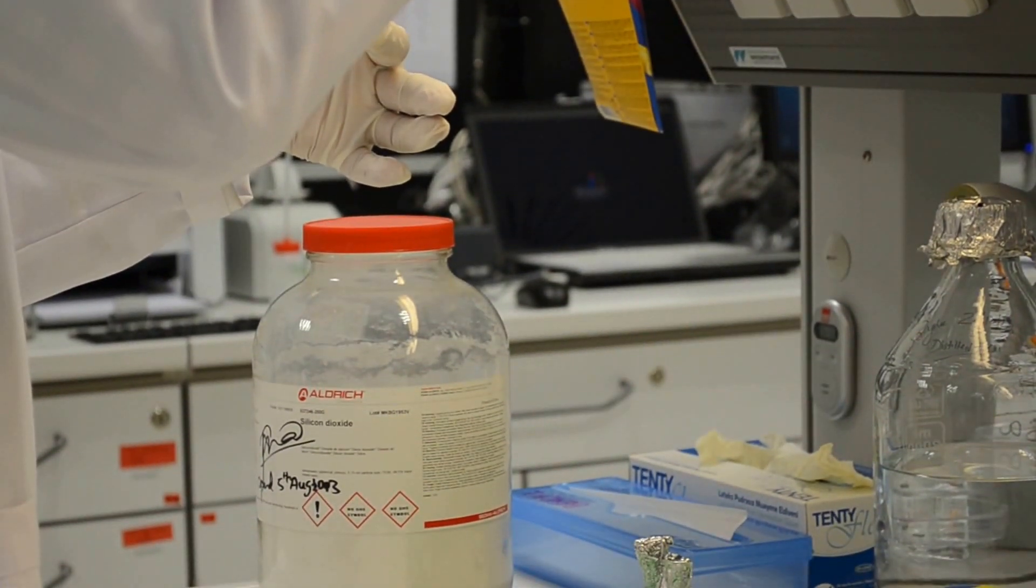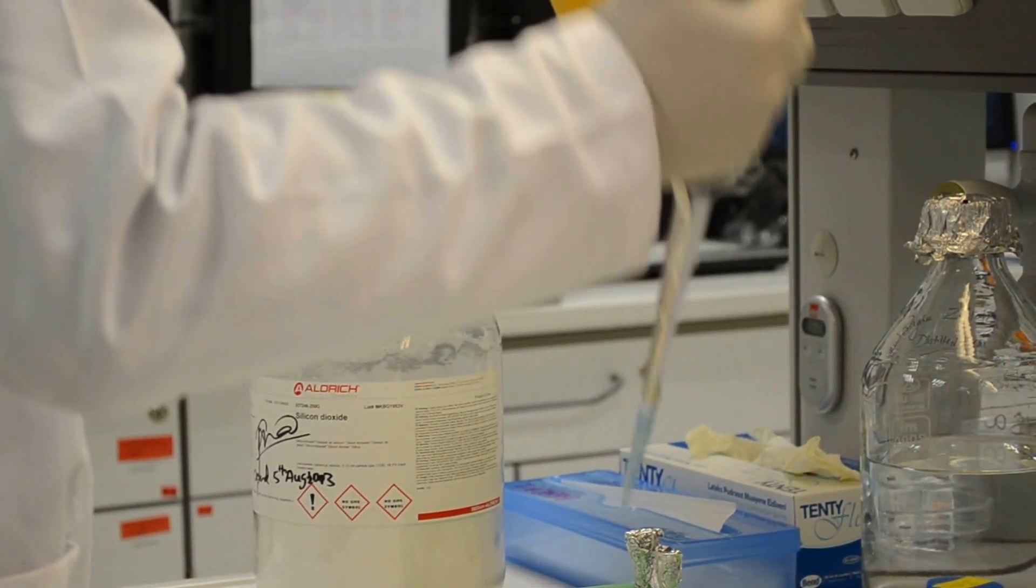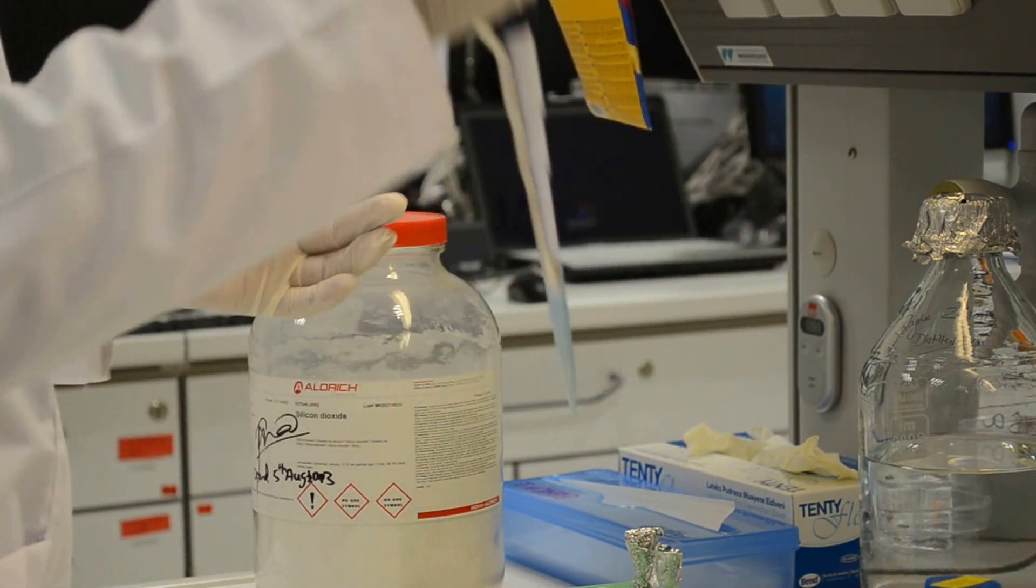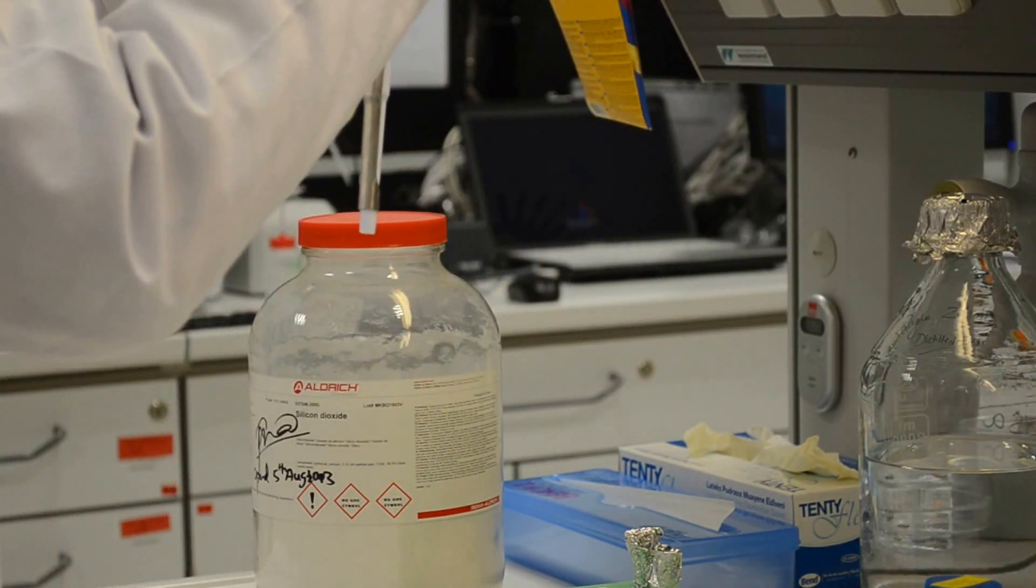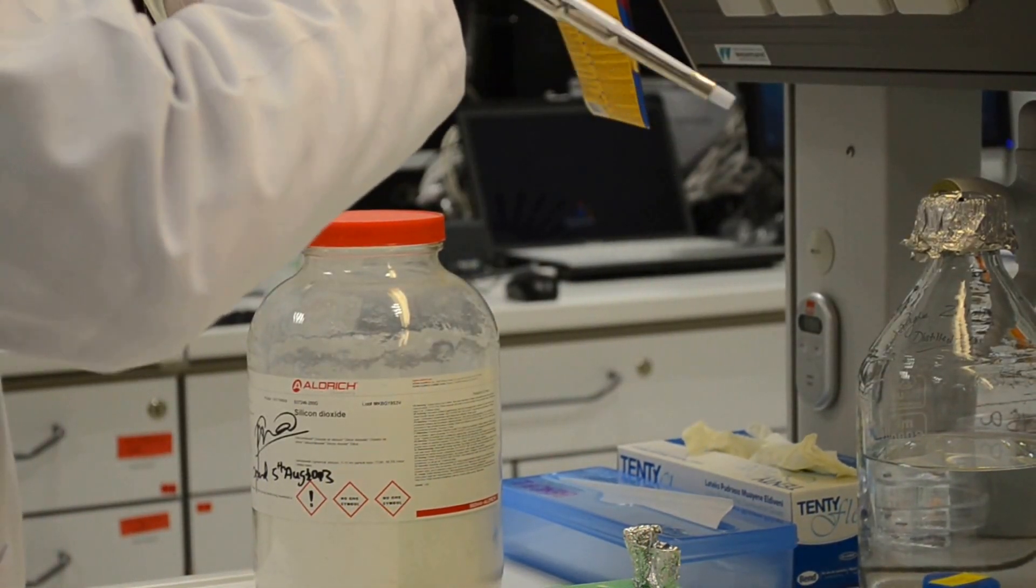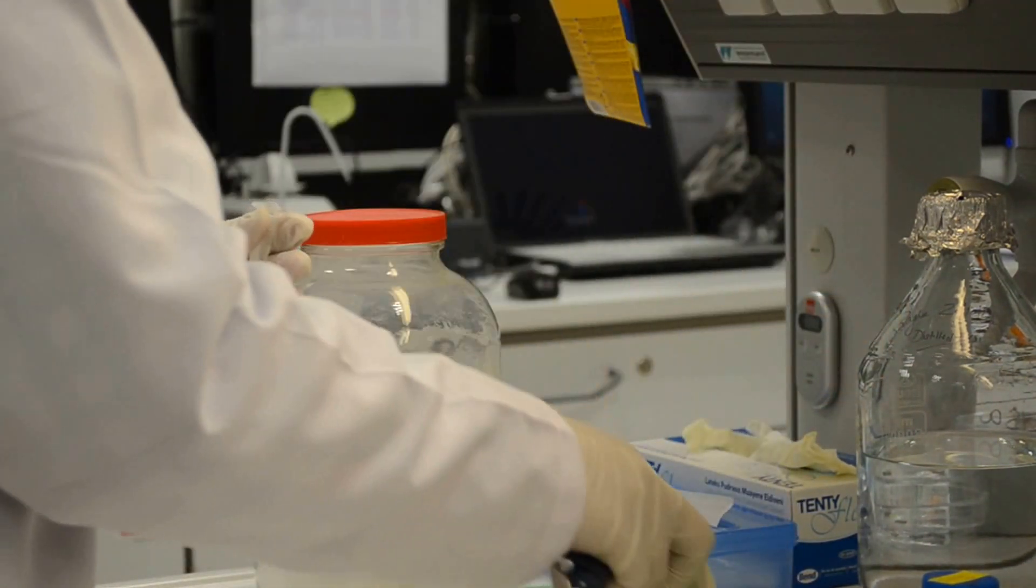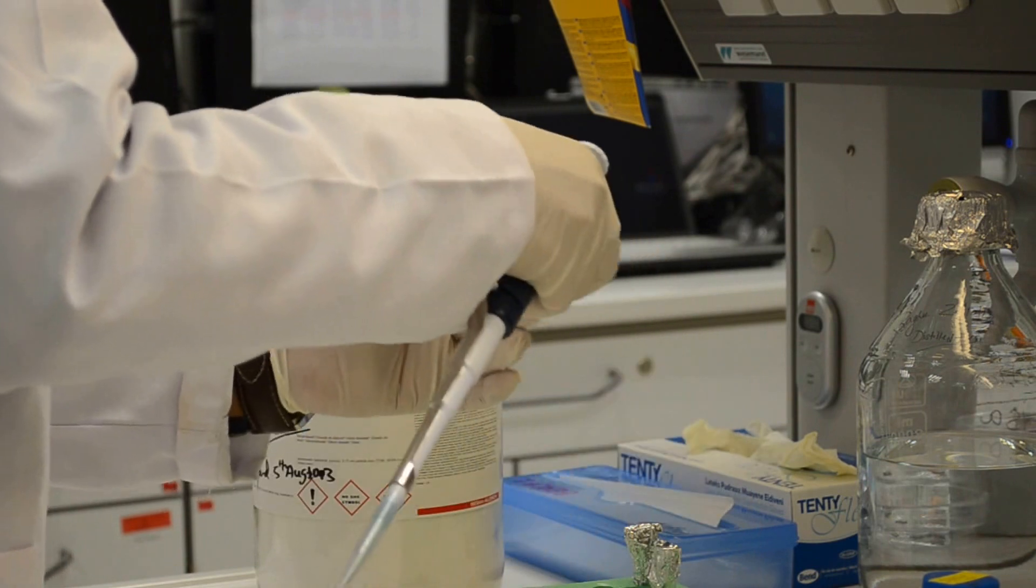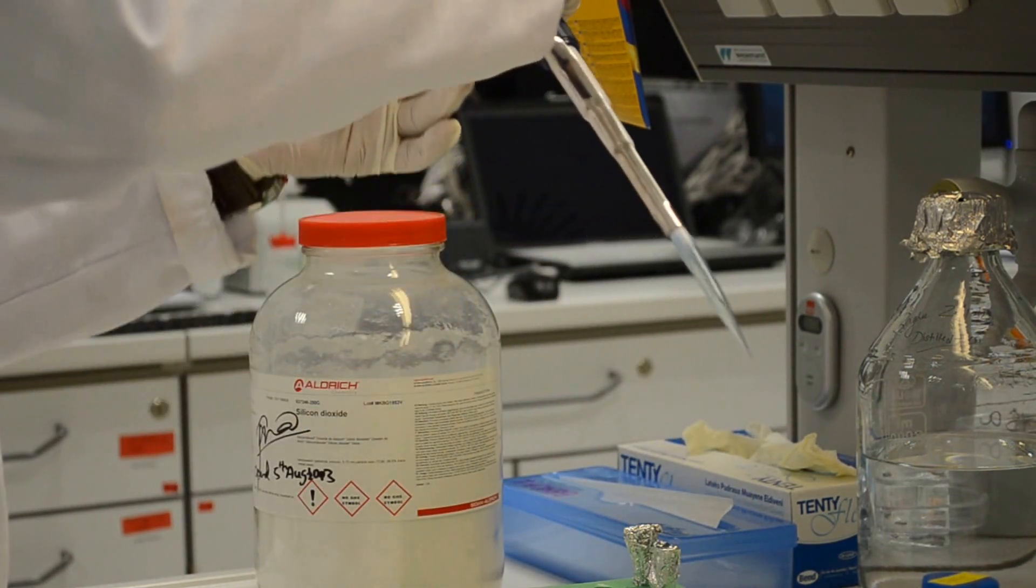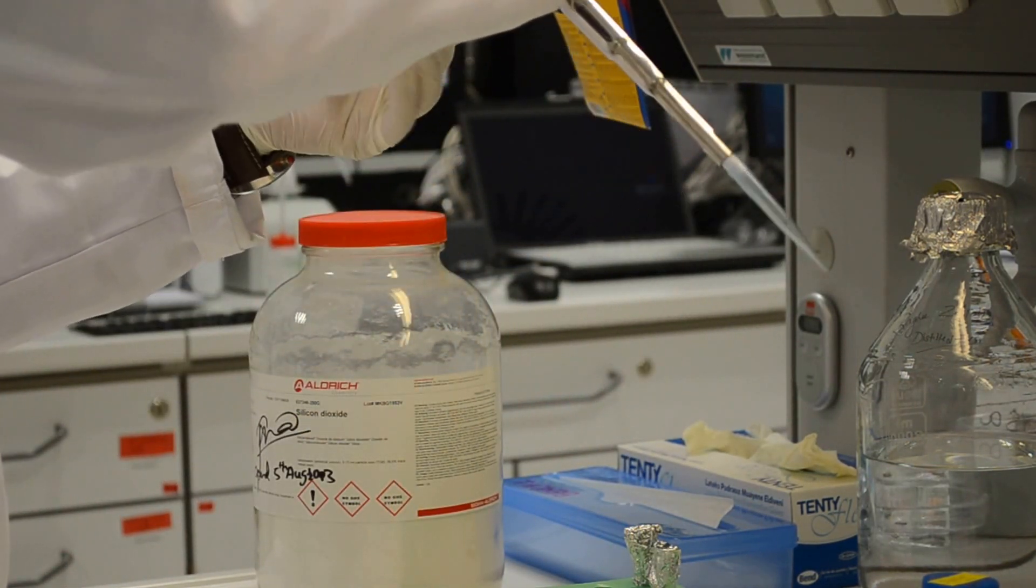The supernatant will be taken out in a fresh tube, just to make sure how much of quantum dots went inside the silica particles, which can be measured by fluorescence spectrometry, which we have. We are not going to do at this moment. This is a trial experiment.